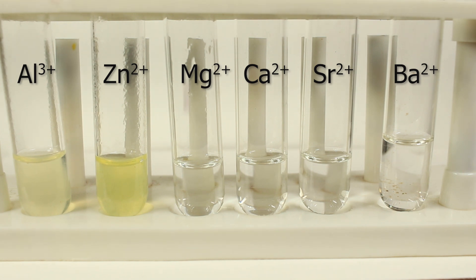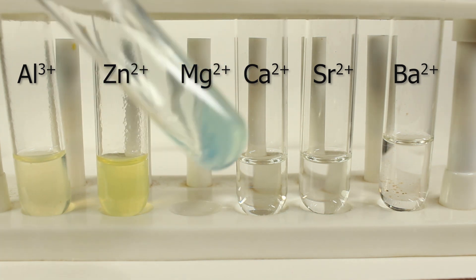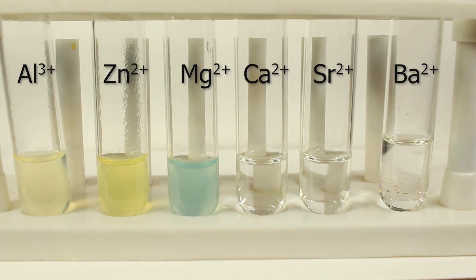Characteristic test for magnesium. Blue precipitate or blue lake. If I shake it out. Blue precipitate clearly visible. Setting it apart from all the rest.